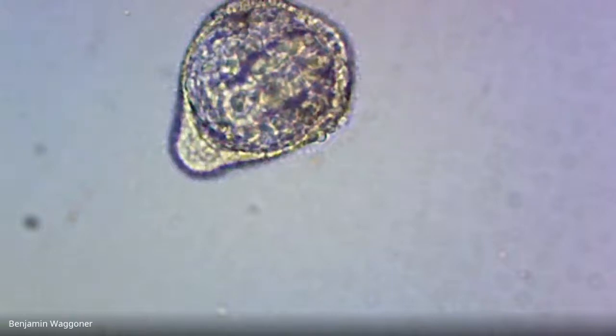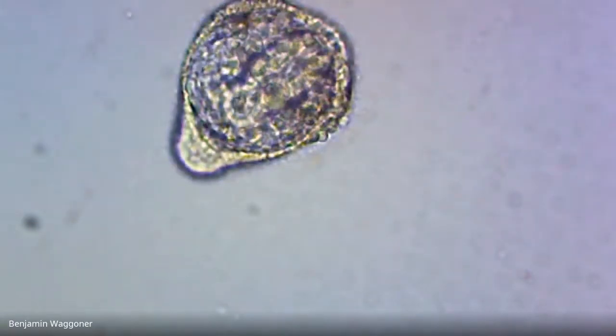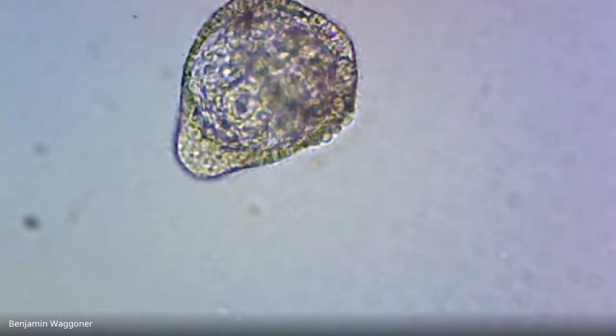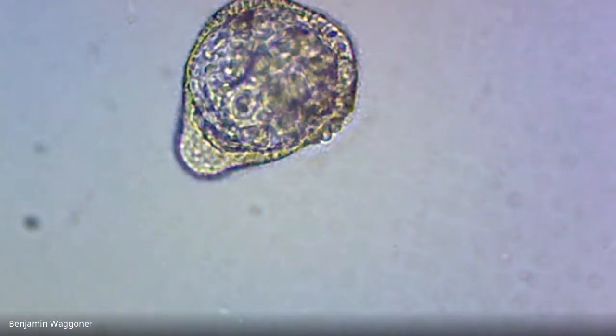And that's yet another prism larva. And you can see the gut there. I think that'd be the anus at about your 10 o'clock. And then pointing down in the 5 o'clock direction, that's your gut. I think it is. And of course, I'm right because I have a PhD and you don't, so neener, neener.